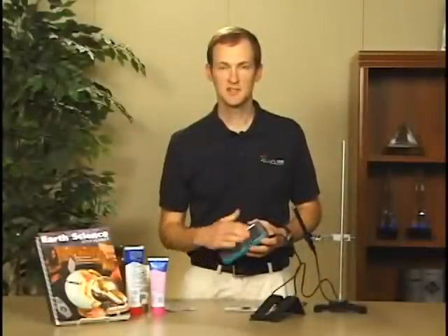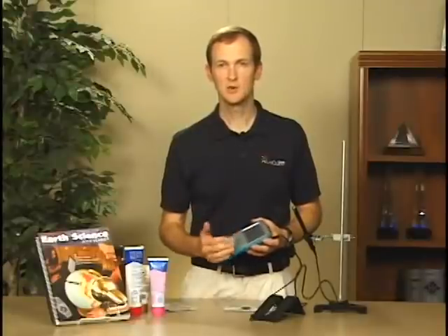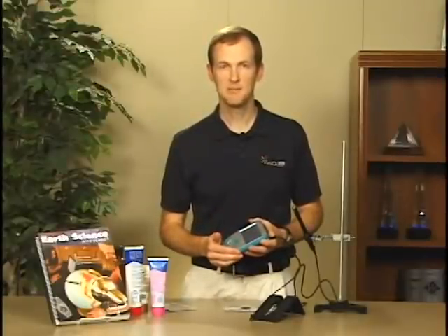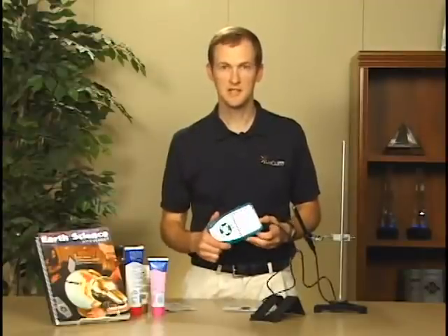We could also do this activity with the same sensor and a Golink or a LabPro interface connected to a laptop, but because the LabQuest is so portable, it makes a really nice way to do this activity outside.